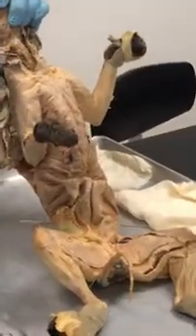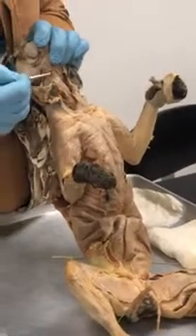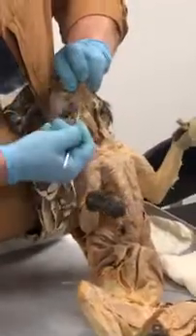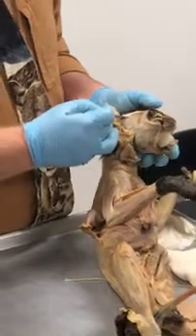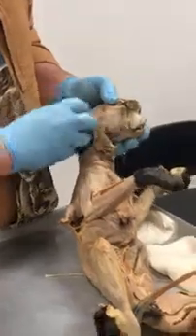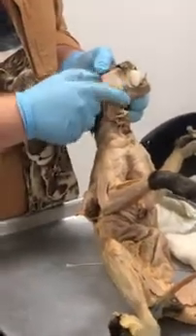So go through it again. What is this muscle that goes from the sternum to the hyoid? Sternohyoid. The one that goes from the hyoid going up? Mylohyoid. The one that's like the upside down V? Digastric. Good. The one that is up here on top of the head? Temporalis. And the one on the cheek that's really thick? Masseter.